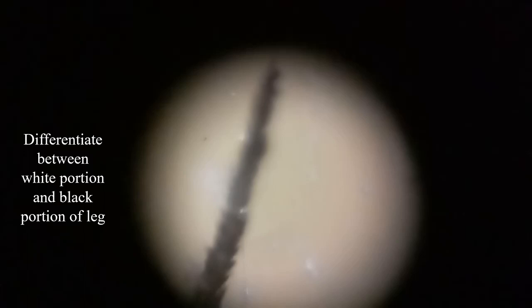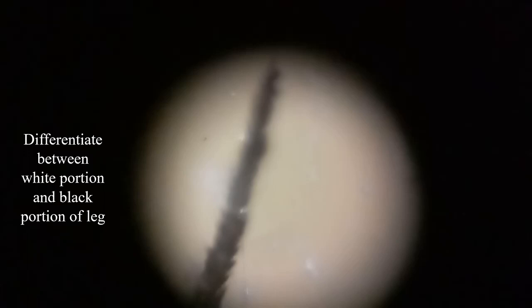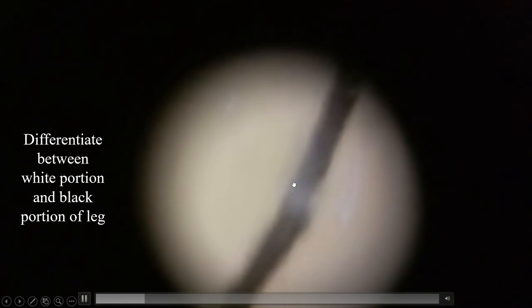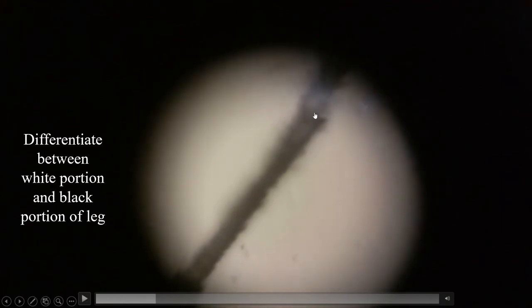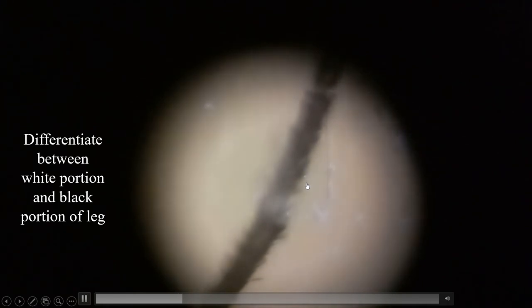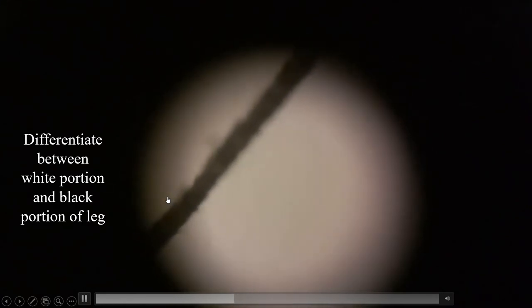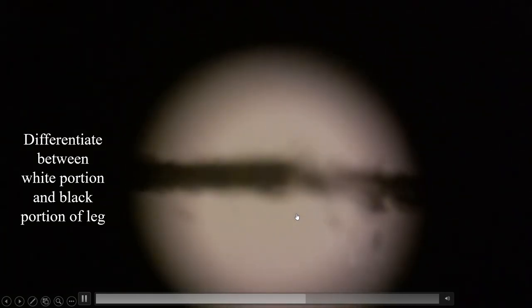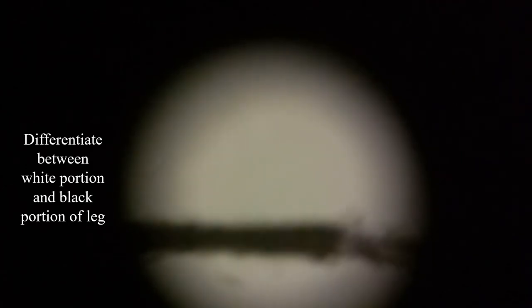In another section, we can see the microscopic view of the black and white color portions of the mosquito leg. This is the white portion of the microscopic view of the mosquito leg. It has been clearly visible what the difference is and how the variation looks in this video. This is one more mosquito leg — see how thin a leg can be seen clearly under the foldoscope.